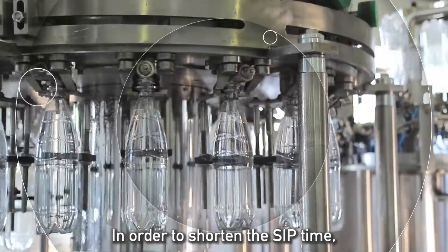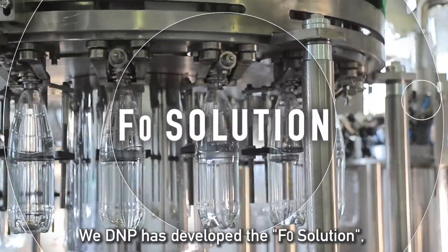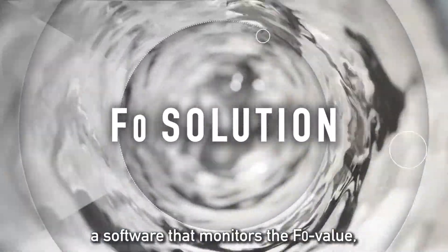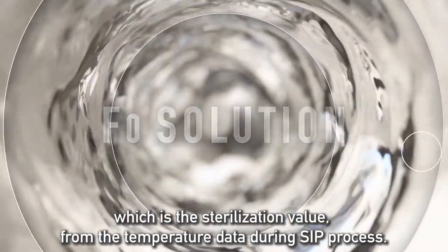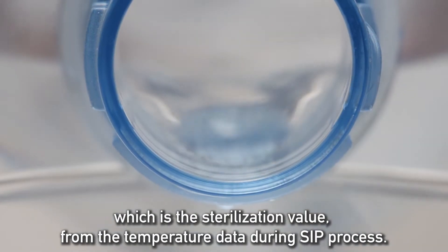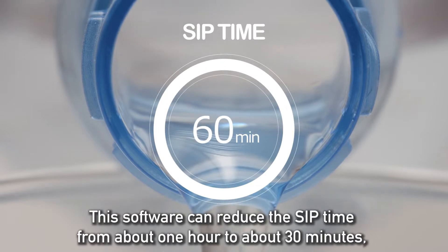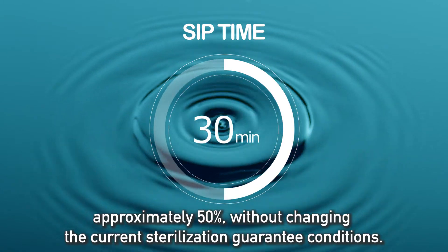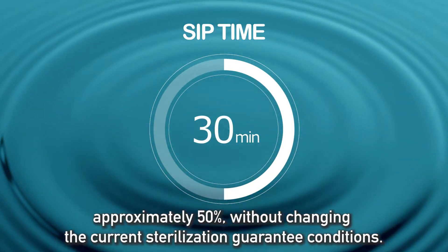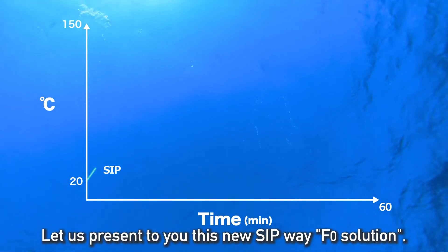In order to shorten the SIP time, we, DNP, has developed the F-sub-O solution, a software that monitors the F-sub-O value, which is the sterilization value, from the temperature data during the SIP process. This software can reduce the SIP time from about 1 hour to about 30 minutes, approximately 50%, without changing the current sterilization guarantee conditions. Let us present to you this new SIP-Way F-sub-O solution.